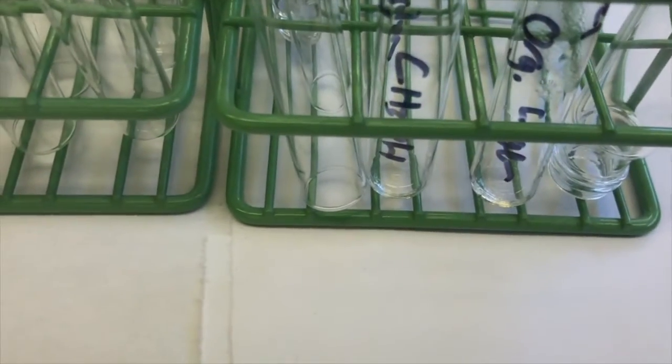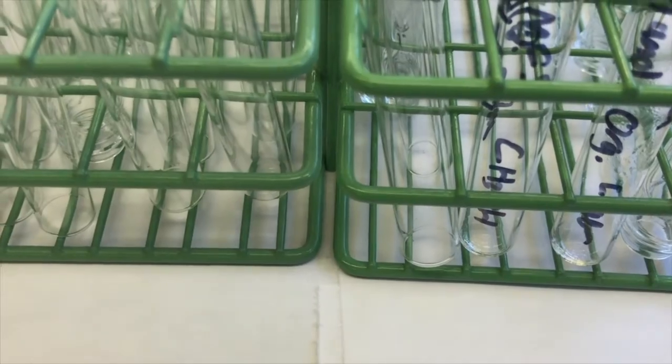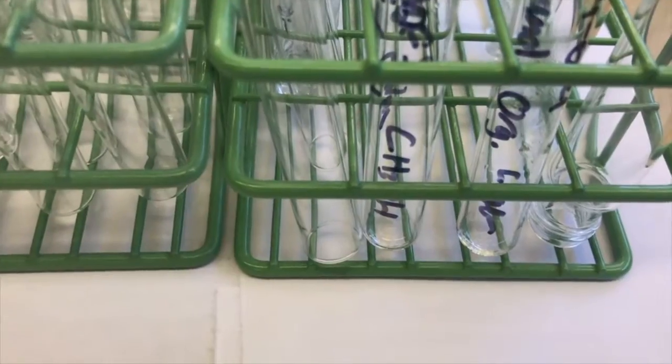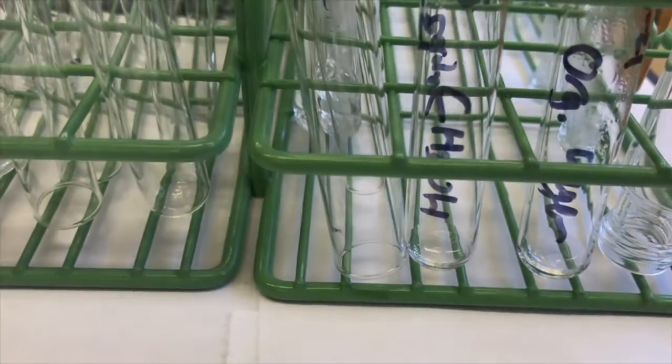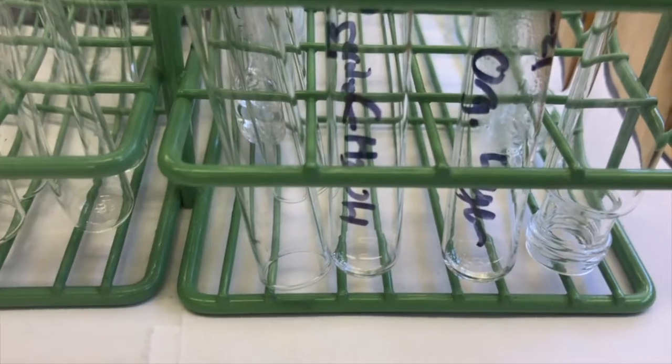I'll go ahead and grab my glassware for the crystallization. And while I'm doing that, these will be cooling, and I'll come back and show you what we got in the video after a little bit of cooling. I'm going to use methanol because we haven't seen that one yet. And it'll be good for you to see the differences with using methanol as a crystallization solvent versus ethanol.